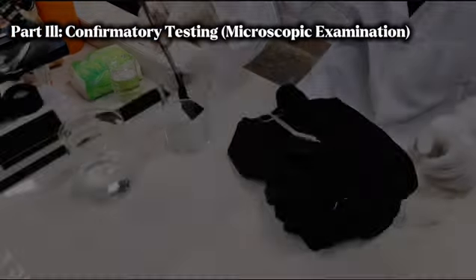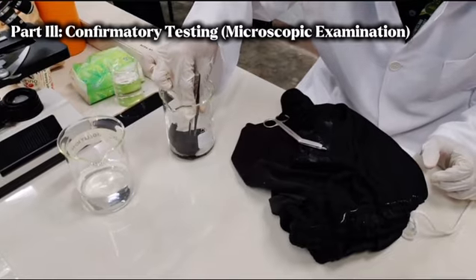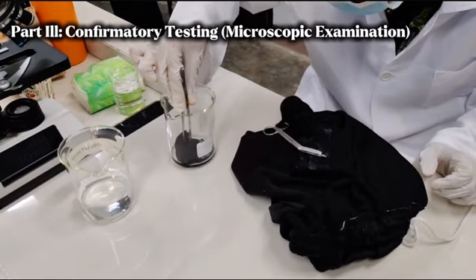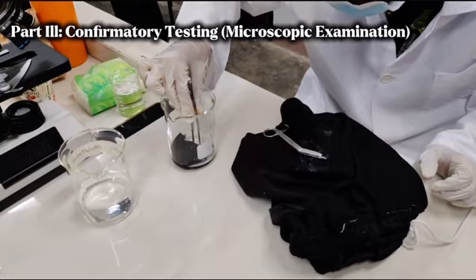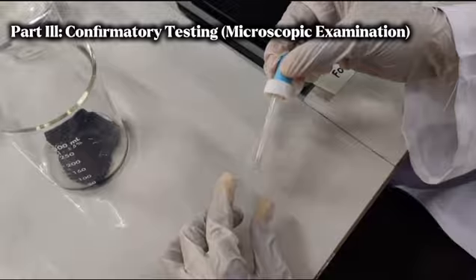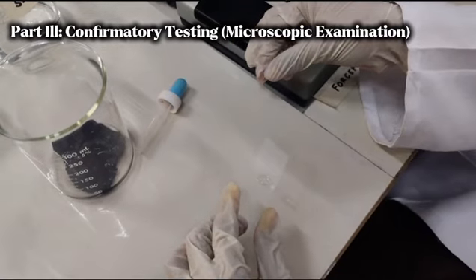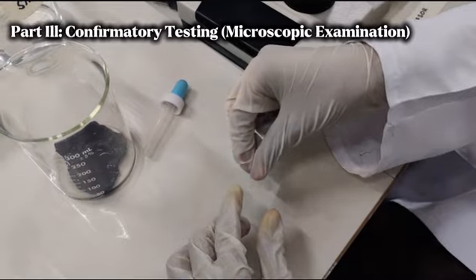After cutting, we will put it in the beaker with our saline solution. The purpose of this is to separate the suspected seminal stain from the cloth. And using a dropper, we will take some samples and put them onto the glass slide.